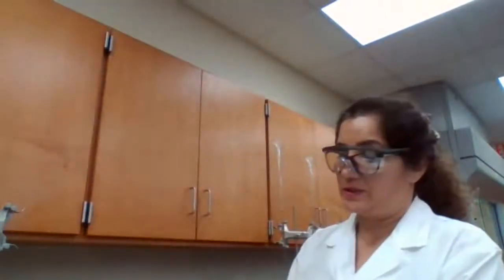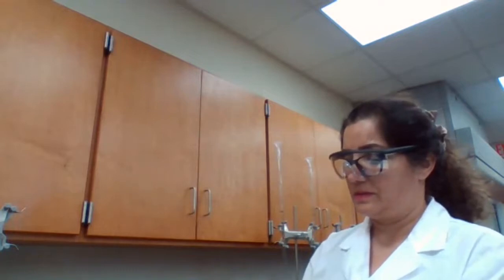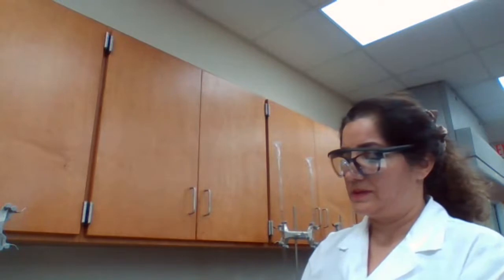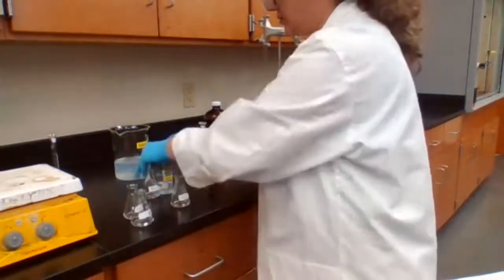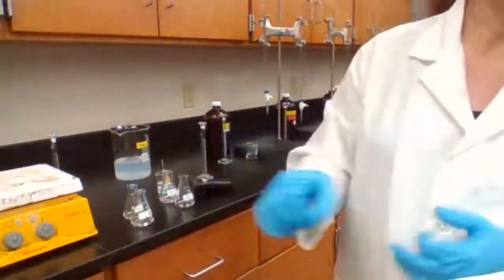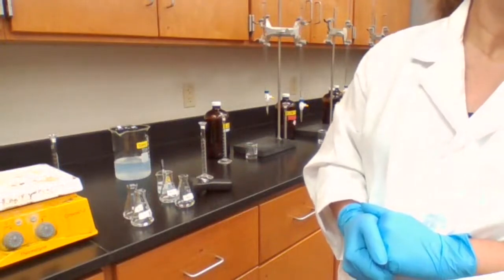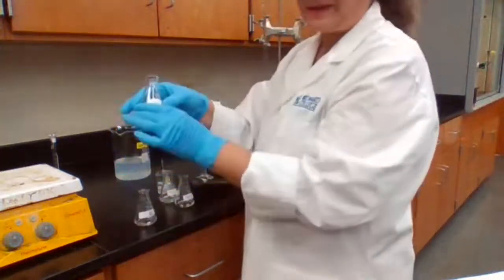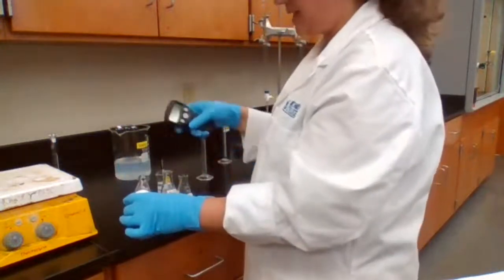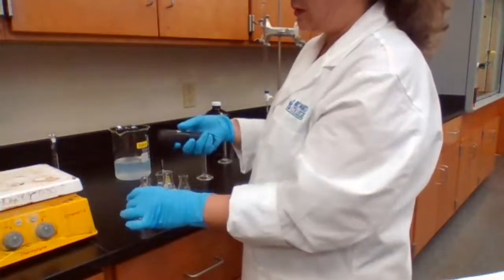Timer, so make sure that it's on. Start, stop, reset. Okay. I have my flasks A1 and B1 ready, A2, B2. So for trial 1 and 2, I'm going to record the number. So going to mix A1 with B1 at the same time. As soon as the two liquids touch each other, I'm going to start the timer.